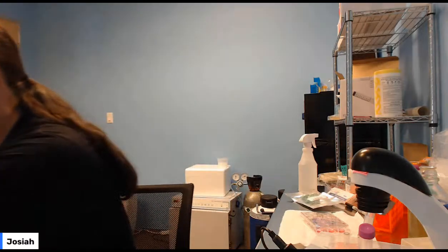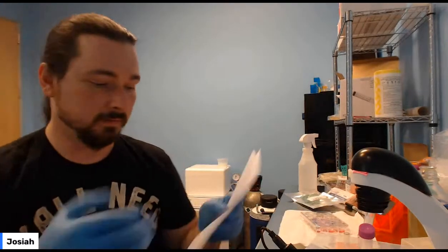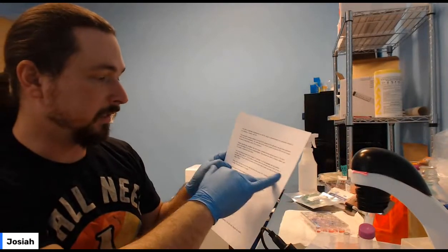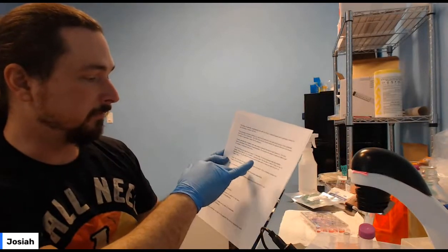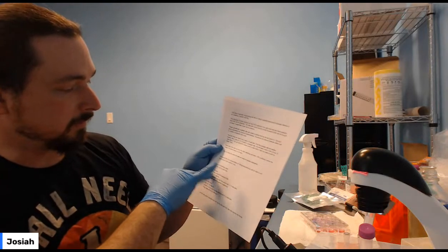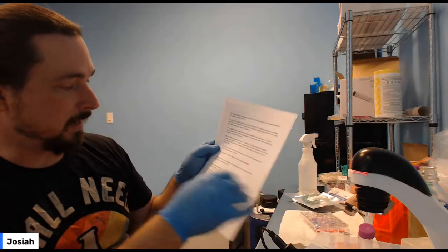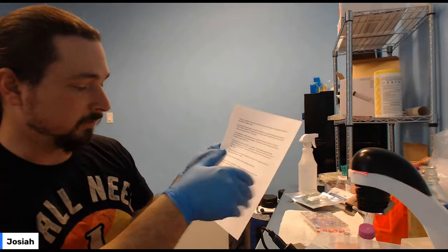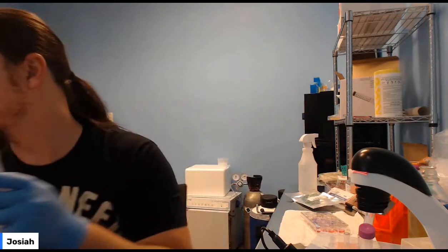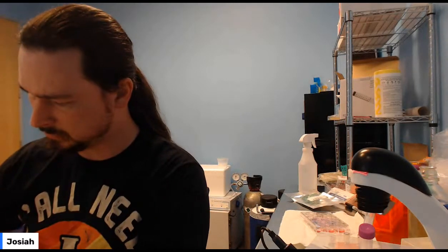And again, the protocol is in the classroom and it lays out what the days are, so you see the plate, keep track of it. When they hit 70% confluency, that's about 3 to 5 days. Replace the media, go through the amount of DNA and lipofectamine to add, and then let them grow overnight. Add the DNA, but don't change the media. Next day, change the media.